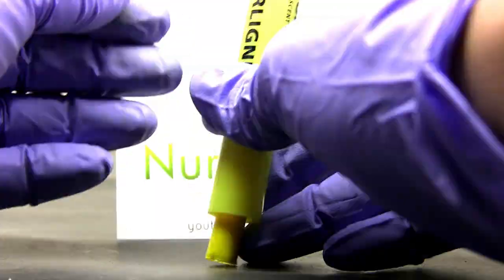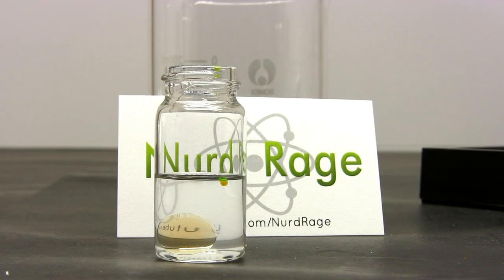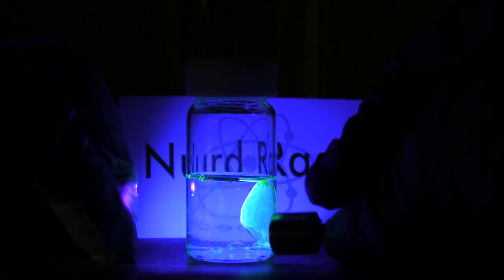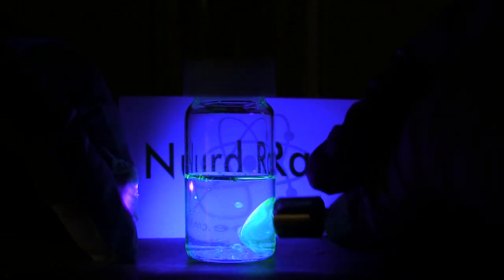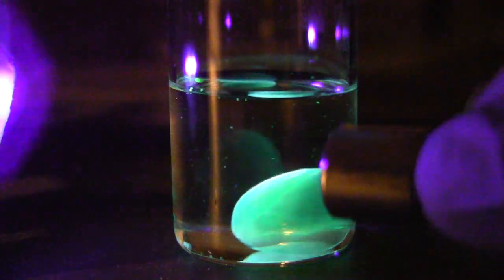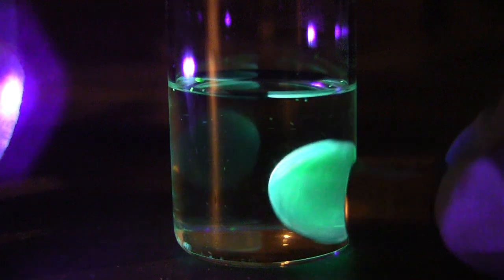Another fun trick is to make it fluorescent. The paramagnetic fluid is clear so we can use a drop of highlighter fluid. Once it's mixed in we shine ultraviolet light and now we have a fluorescent paramagnetic fluid. Here it is again close up, exactly what use this would be I have no idea but I'm sure you artists can figure something out.